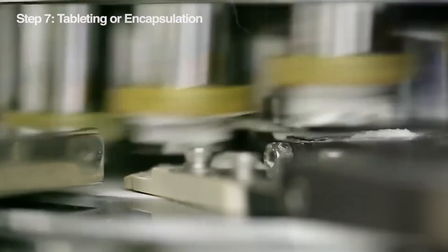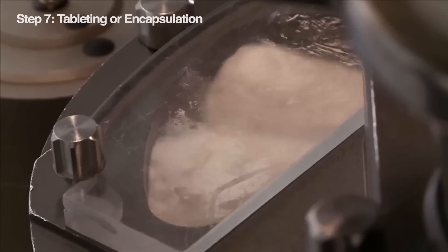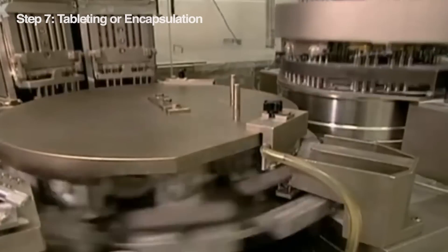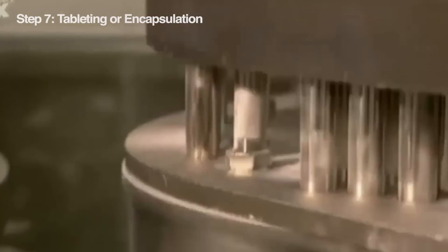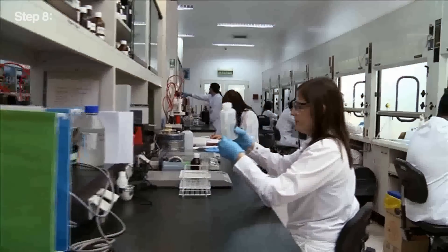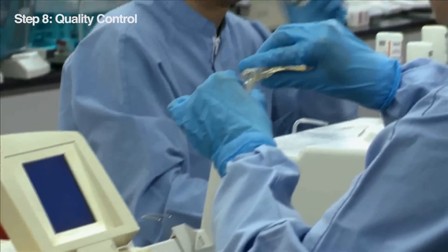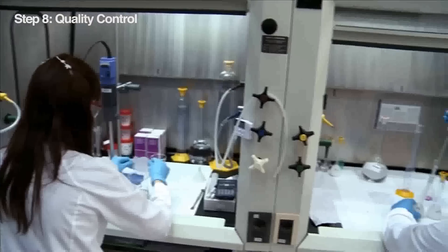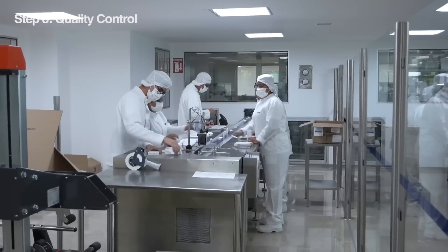We have now reached the point where we give the pills their shape or make capsules with this powder. The dried aspirin powder or granules are pressed using tablet presses, turning powder to pill. Using the tablet press is like using a giant stamp, pressing the aspirin powder into those familiar tablet shapes. For the capsules, the powder is filled into casings made of gelatin. The most important thing is to get the exact dose into each tablet or capsule. That is where quality control comes in — every tablet or capsule has to be top quality. Throughout the production process, scientists take little aspirin samples at different stages and test them to measure the exact concentration of aspirin in each one. If a batch passes this test with flying colors, it gets the green light for becoming tablets or capsules.